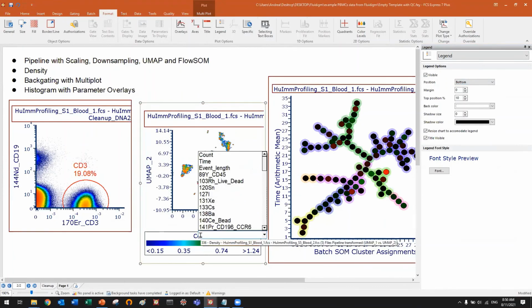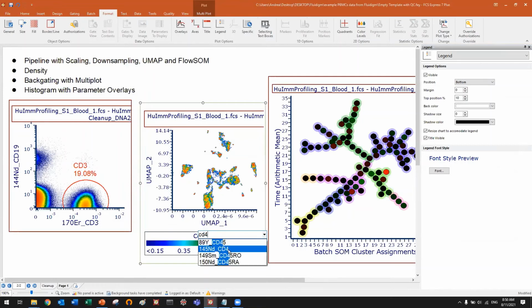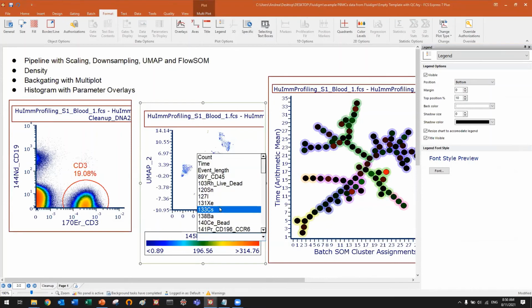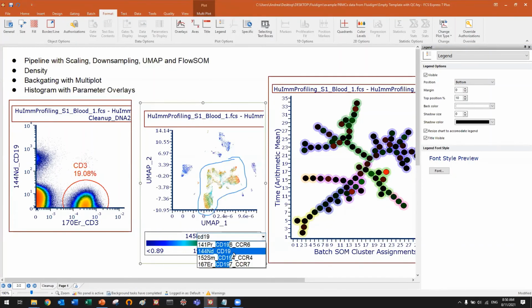What about if I change this and I say, okay, I want to see the CD4 coloring. Now I can clearly see that the CD4 cells are located in this region. Okay, what about the CD19? Okay, they're here, if you can see. It's very, very red here.